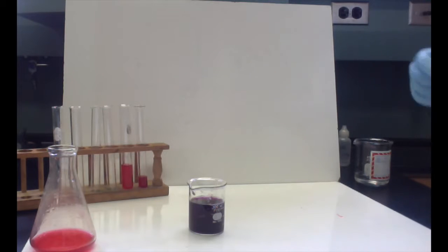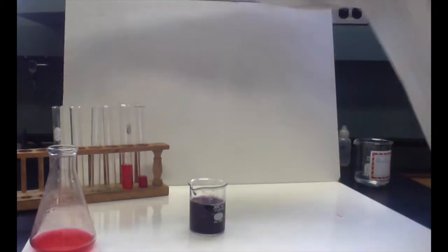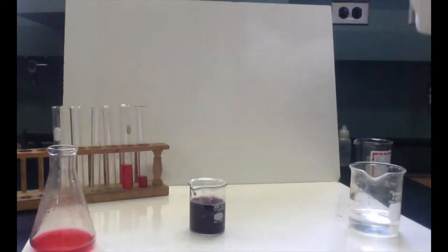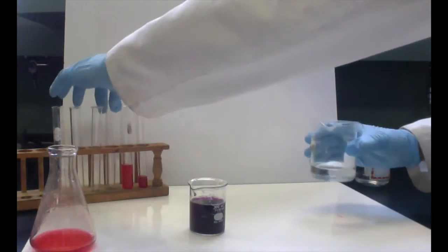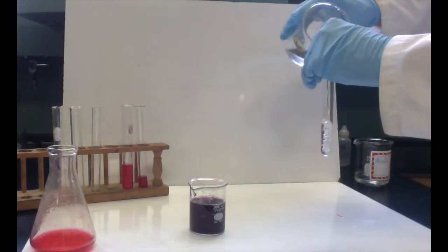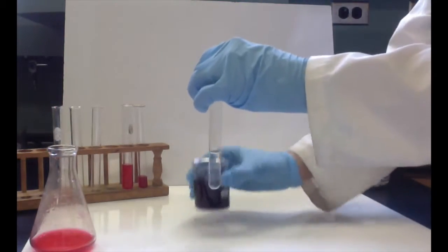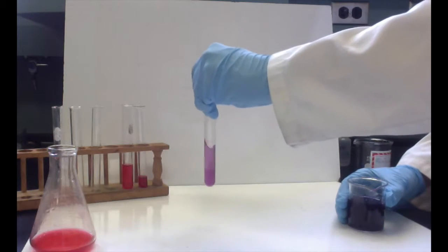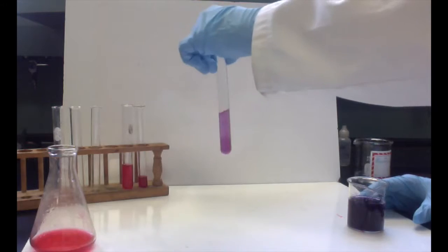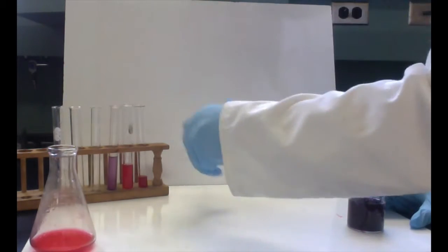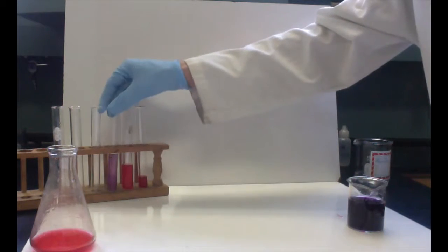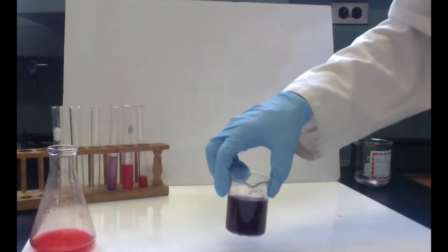Now next, we're going to take the opposite end of the spectrum. By the way, if we just had regular water, let's just get a little bit of plain water. So plain water should be pretty much just that same purple, but lighter. Paler. So that's the middle of the pH scale. We have this bright red for sulfuric acid, a little bit less for hydrochloric acid. In the middle, we have this nice sort of pale red cabbage color.